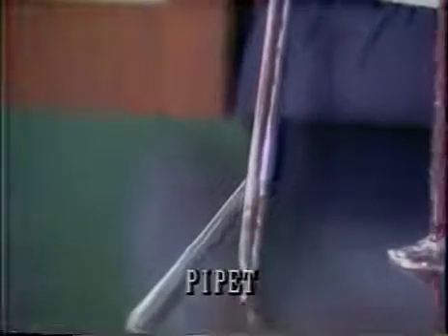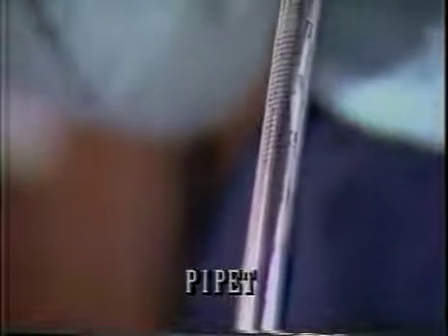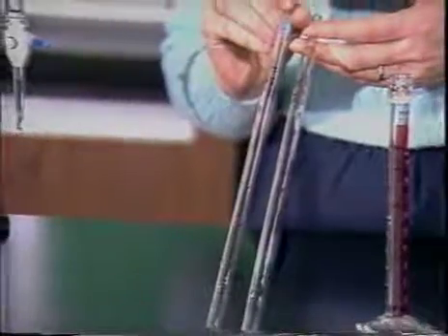And a pipette is basically a very thin tube that we draw liquid up into. This is a 10 mL pipette, and it holds a total volume of 10 mL. We have smaller pipettes. This one, for example, is a 5 mL pipette and holds a maximum volume of 5 mL.